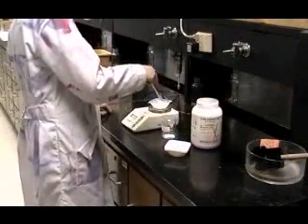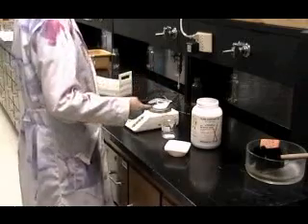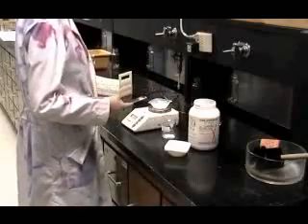To begin the experiment, weigh out exactly 2 grams of salicylic acid. Your instructor may wish for you to place any unused salicylic acid into a waste beaker to prevent contaminating the original bottle.